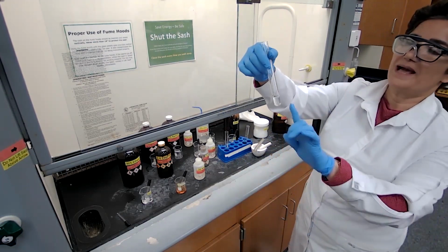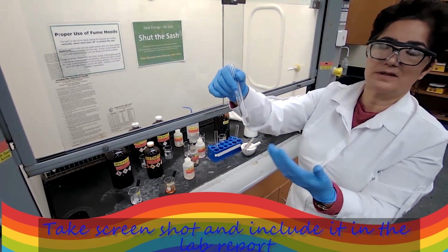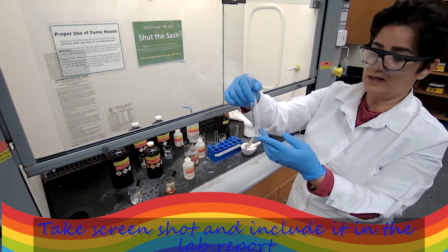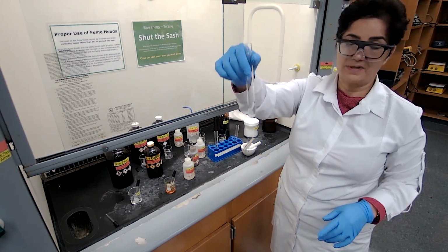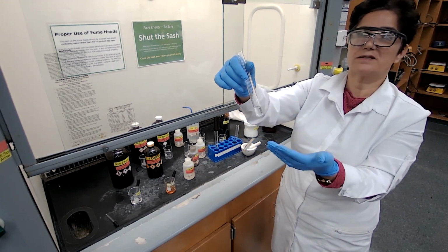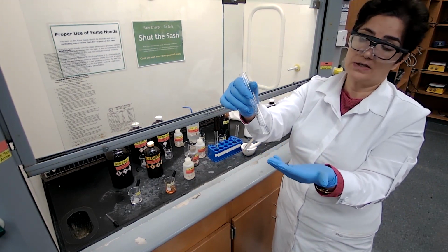If a black precipitate forms, it could mean that there is a reaction. If a silver mirror forms, definitely there is a reaction, and your unknown would be aldehyde. Well, none of that happens yet. I can wait for this, or I can come to the conclusion that this is not an aldehyde, and it could be a ketone.